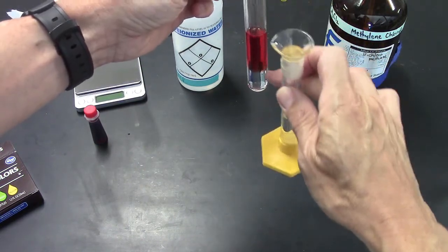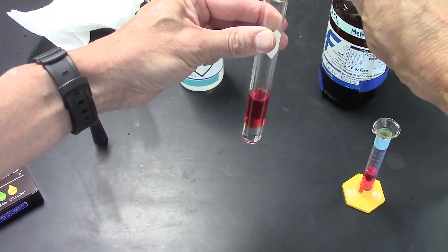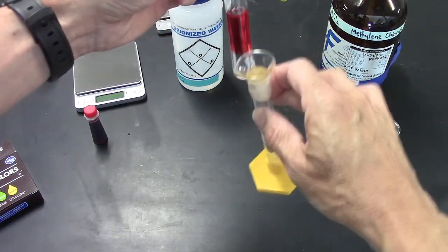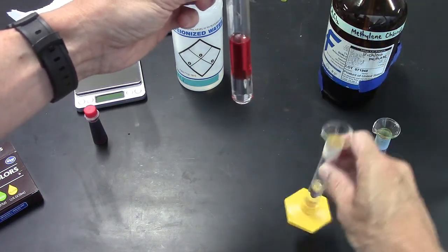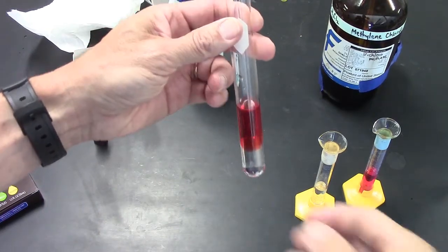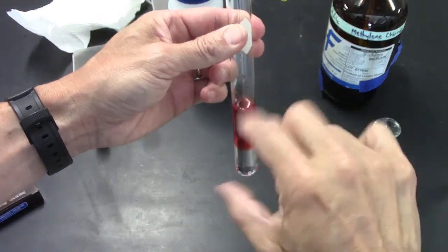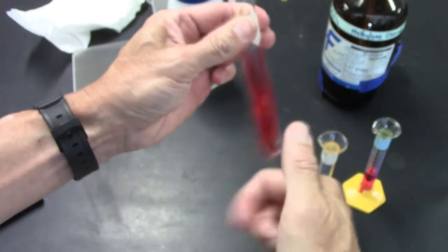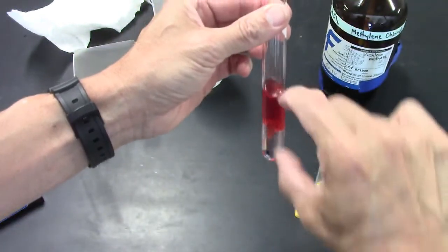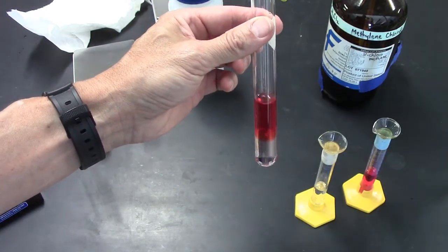The water is the red part, the dichloromethane is colorless. And so this is a demonstration that the denser substance sinks to the bottom, the less dense substance will be on the top. In some cases, if you have layers of different densities and you shake it, they will mix. But in this case, I can shake it, and you can see they don't mix. They stay as separate layers.